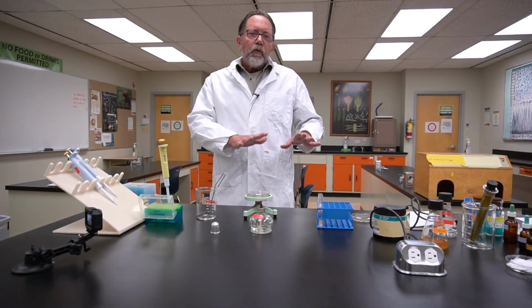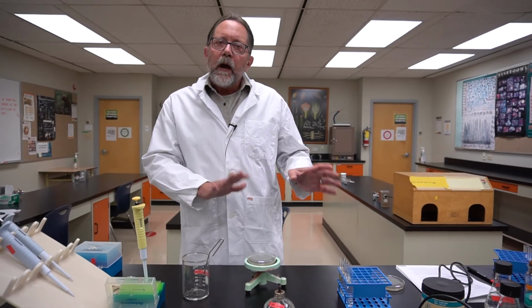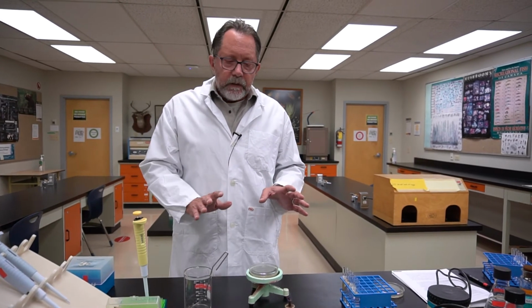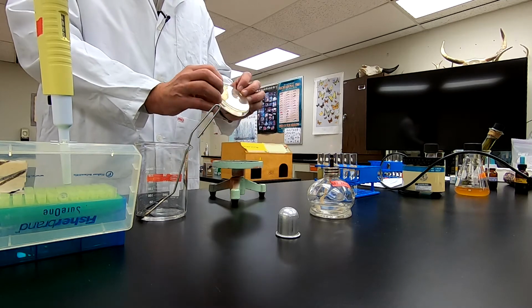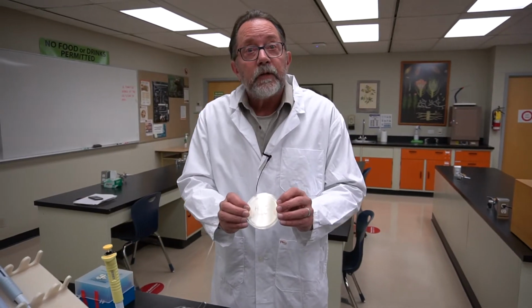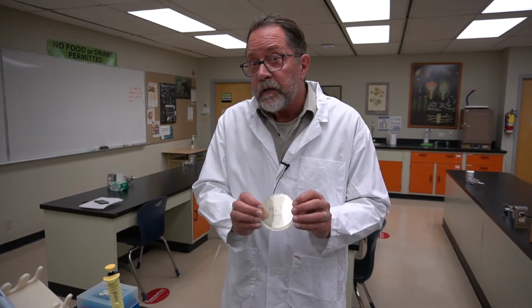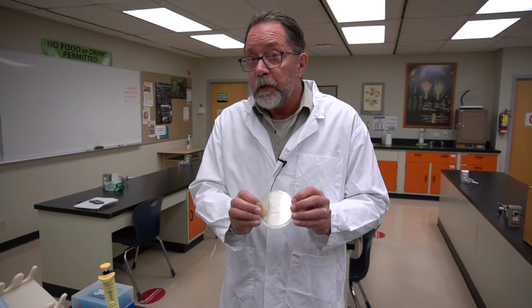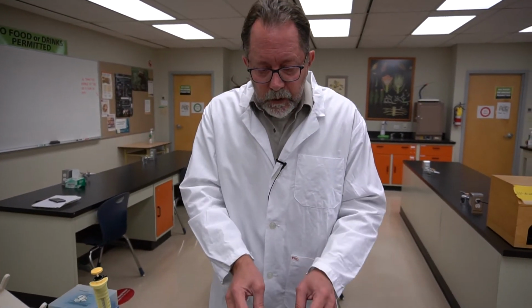Understanding which dilution goes on which plate, now I can show you how you'd plate these cells. So this has His plus. That means I need to take a very low dilution, one that I've calculated that'll put between 100 and 1,000 cells on the plate. Let me show you how you would do this.